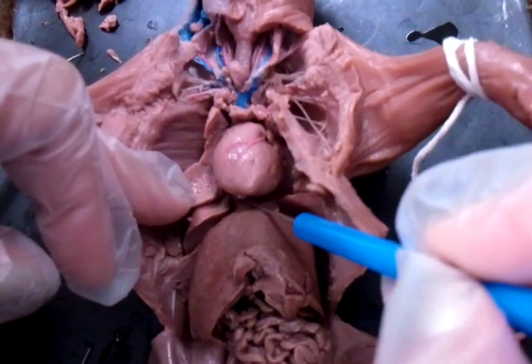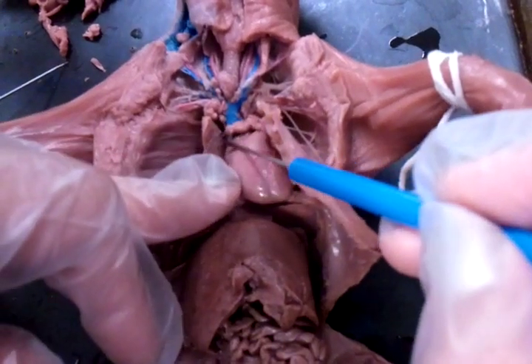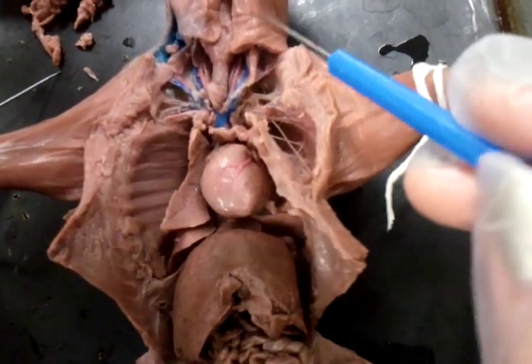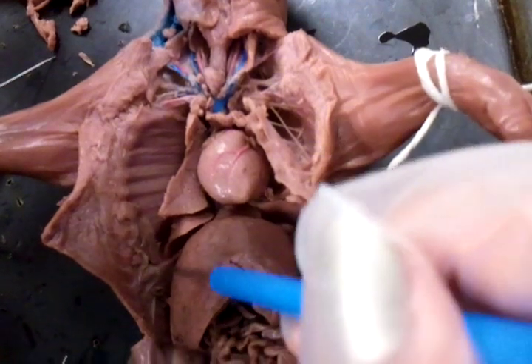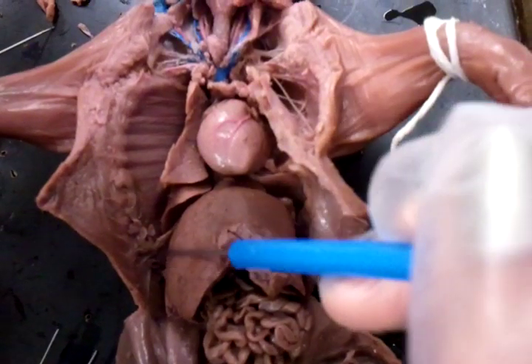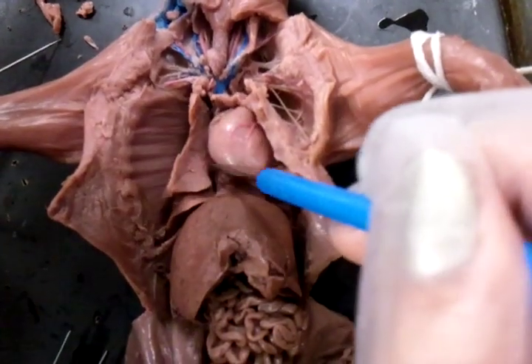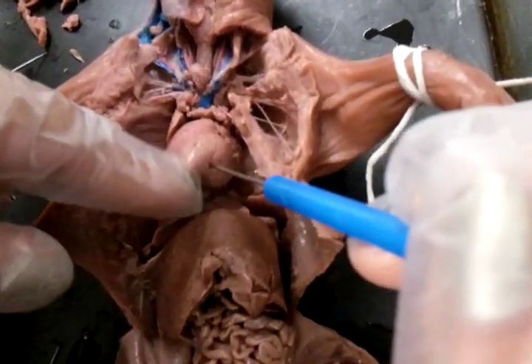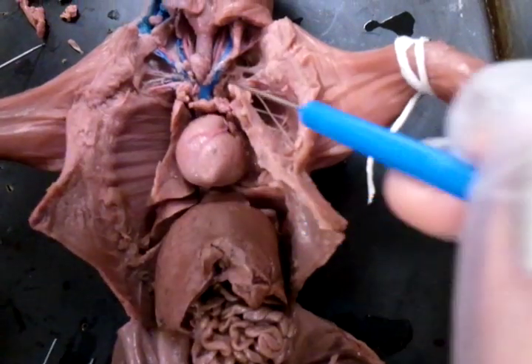Caudal vena cava, cranial vena cava on the top. Diaphragm — the flap that separates from here, it'll probably be cut off. Pulmonary arteries, and then under is the pulmonary veins.